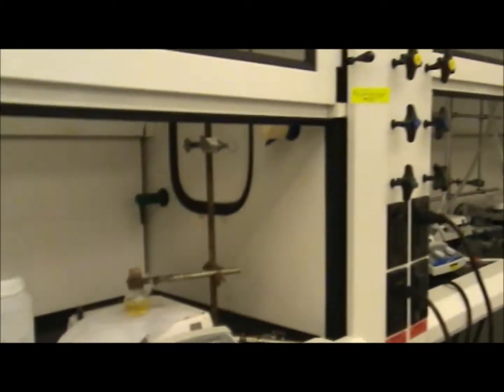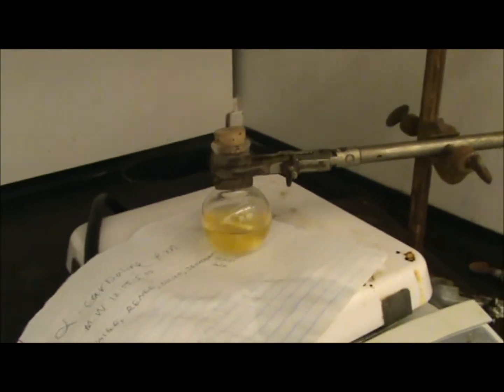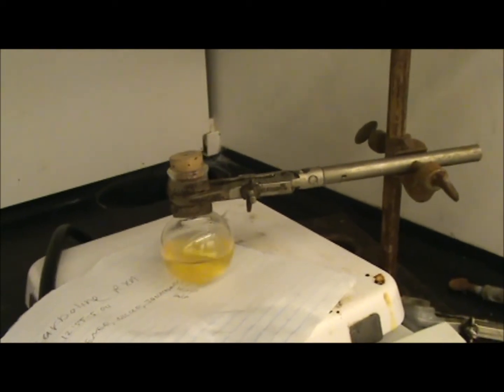Woohoo, we're in lab, and this is our reaction mixture. It's beautiful, right? And we added saturated ammonium chloride, and it turned clear, and so we're letting it go for a little bit.